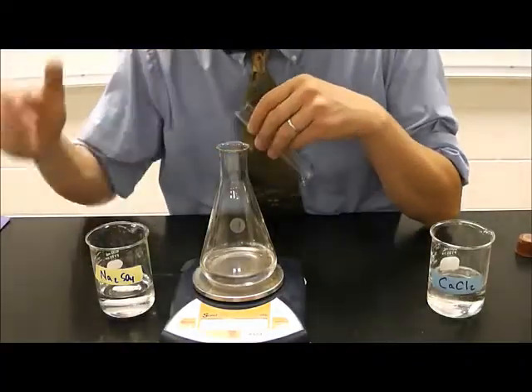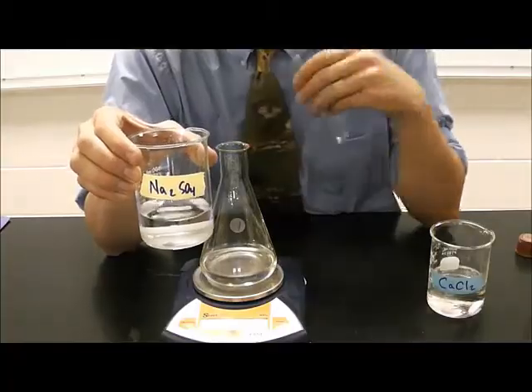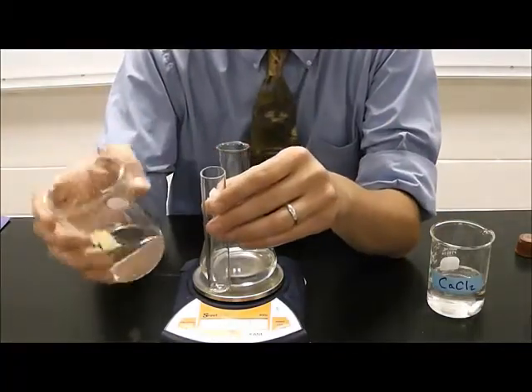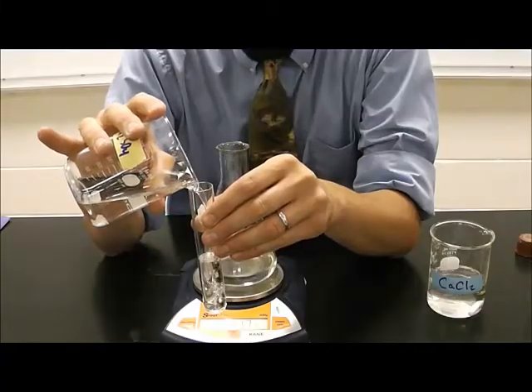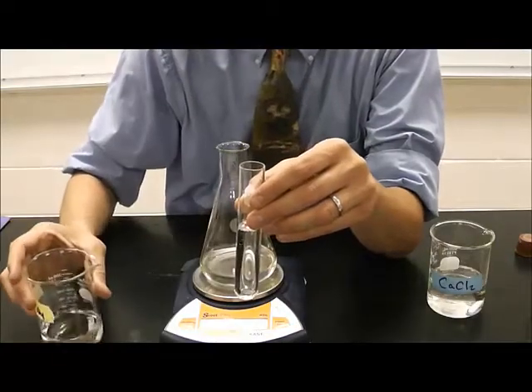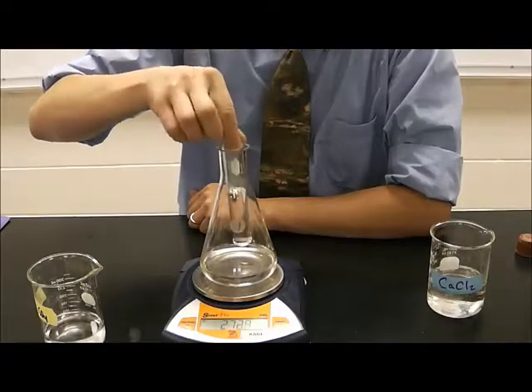In order to have a chemical reaction, we need two chemicals, so I am also going to add some sodium sulfate. I'm going to add it in this test tube. About half full should be good enough. So I'm going to place the test tube inside the Erlenmeyer flask.